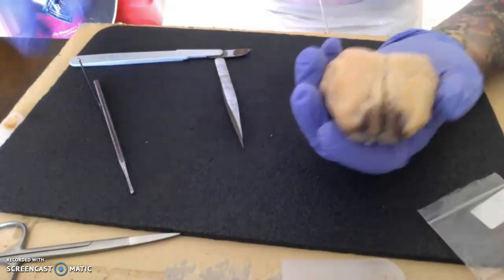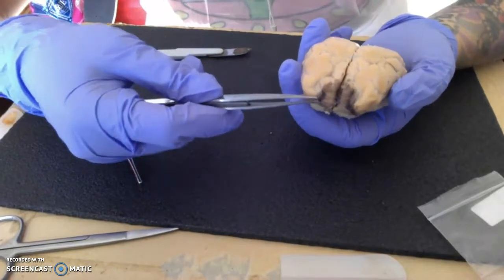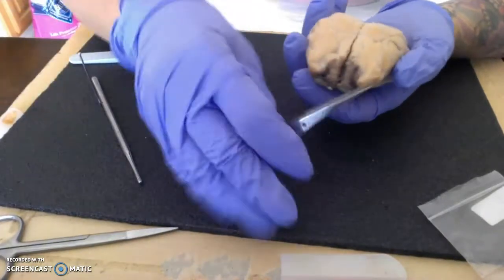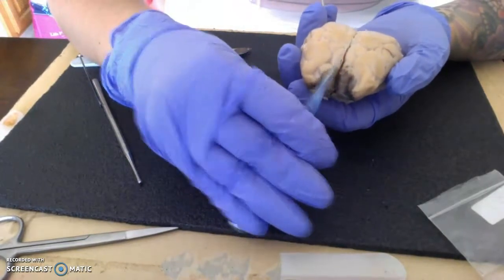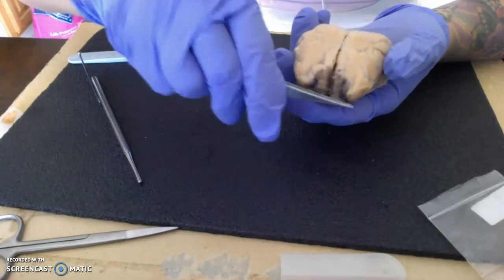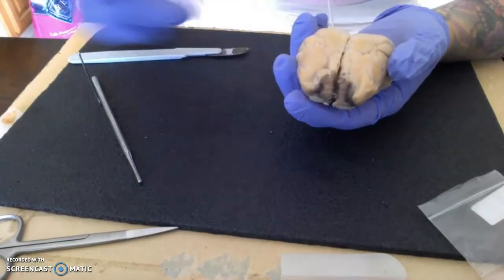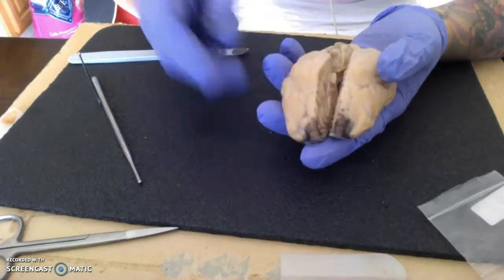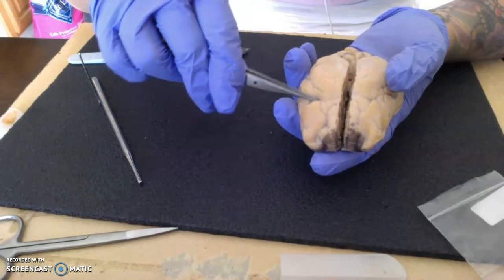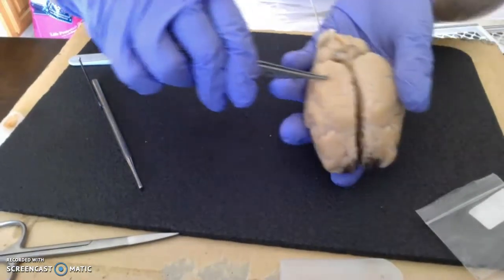And we're going to start with our frontal lobes being in the anterior aspect of the brain. So this would be looking sagittally back, frontal, anterior. Okay, so we have frontal lobe, and then we have parietal lobe separating from frontal to about right here.